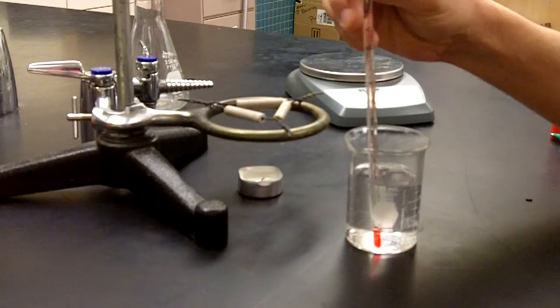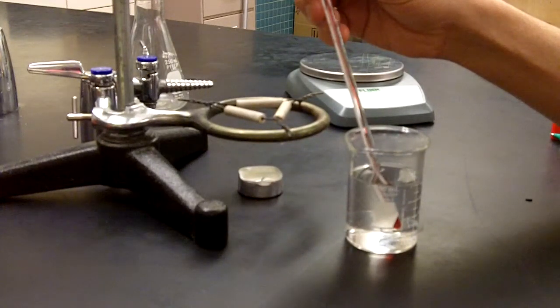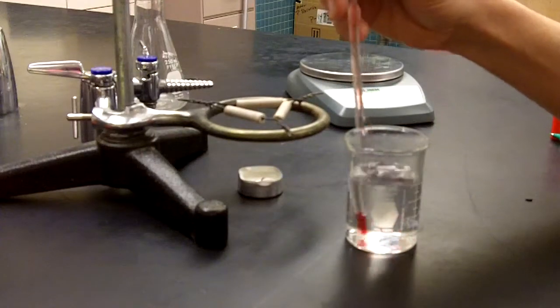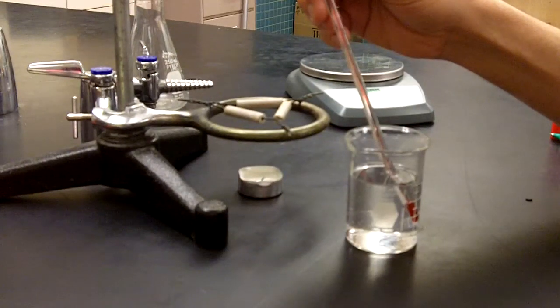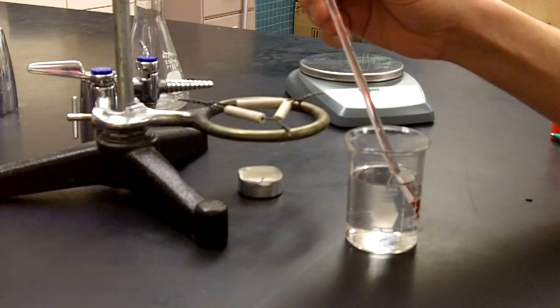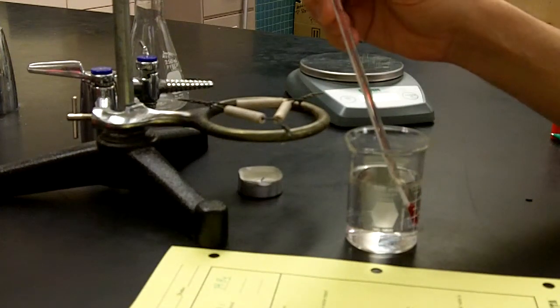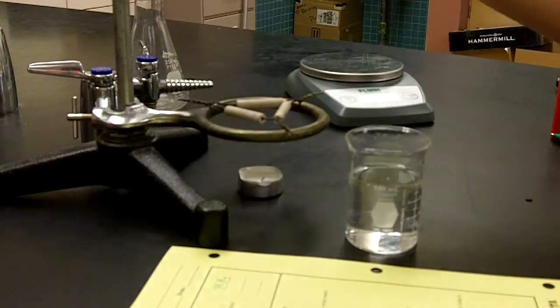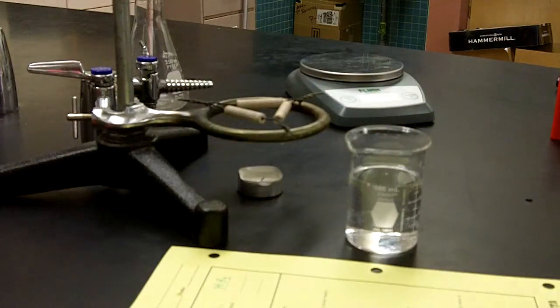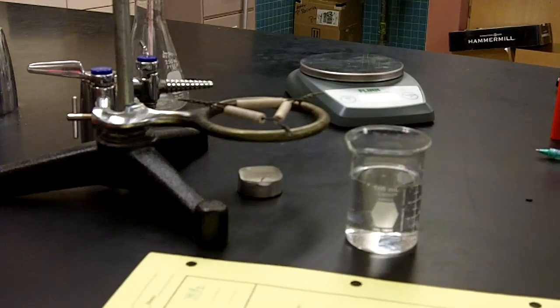Get that final temperature read, because of course the water is cooling off at this point. Alright, looks like it's no longer climbing. It's actually dropped just a little bit. So we're going to say our final temperature reading. So then in the data table on the left, final water temperature, you want to record that as 34.5. 34.5 for final water temperature. And that would be degrees Celsius.